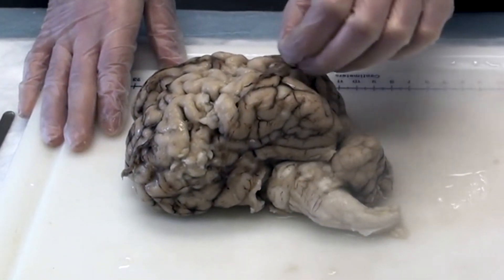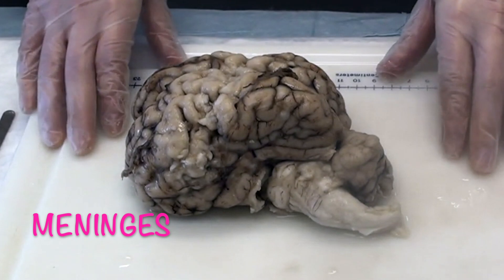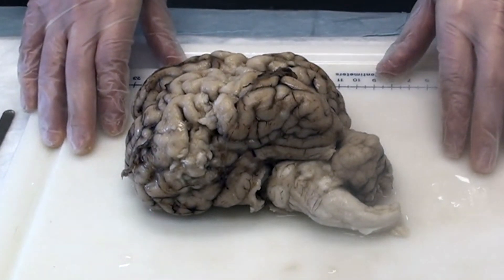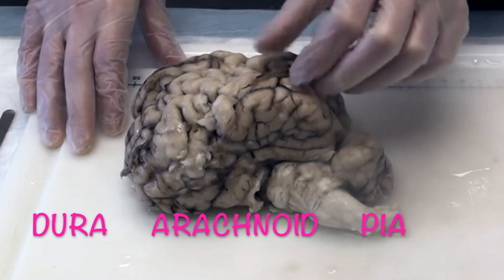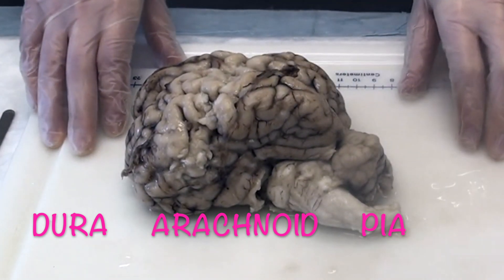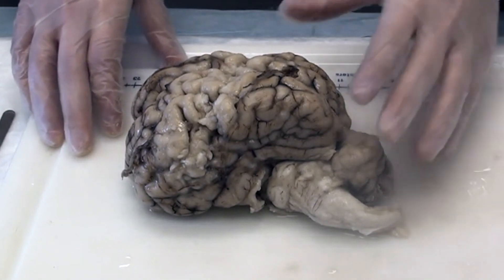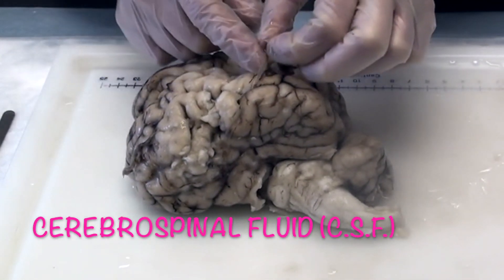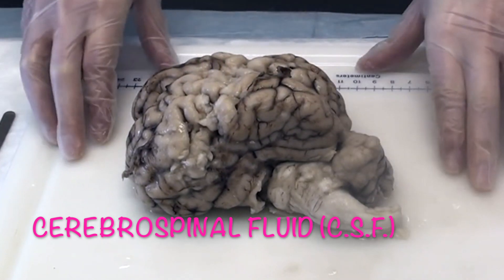These thin layers on the top of the brain are called the meninges. In a living animal there are three of them: the dura mater, which is thicker, and the arachnoid and the pia mater, which you can see here. They help protect the brain. In a living animal or person, a liquid called cerebrospinal fluid fills up the space between the meninges and the brain to help cushion the brain.